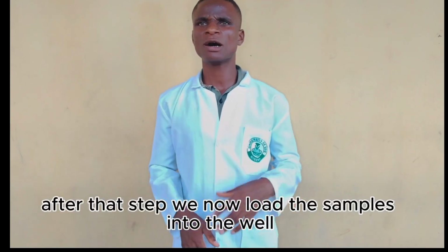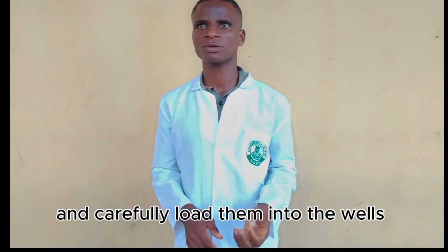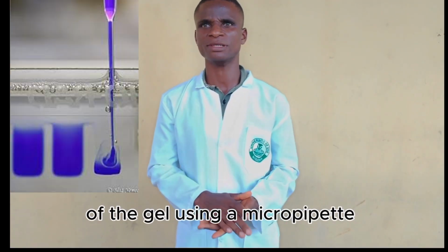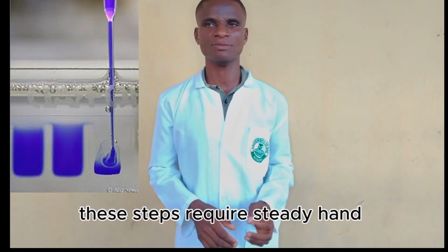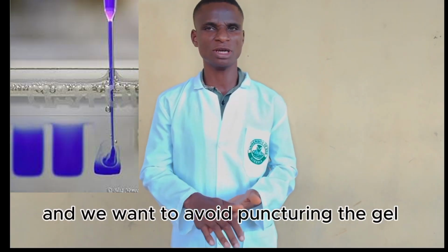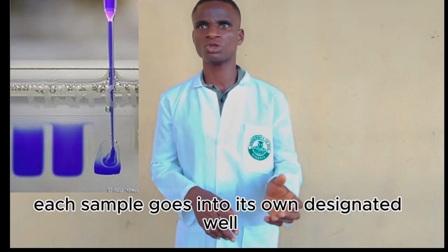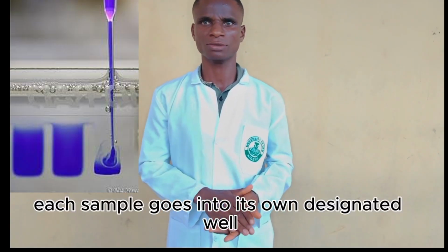After that step, we now load the samples into the wells. We take our prepared samples and carefully load them into the wells of the gel using a micropipette. This step requires a steady hand because the wells are small and we want to avoid puncturing the gel or cross-contaminating the wells. Each sample goes into its own designated well.